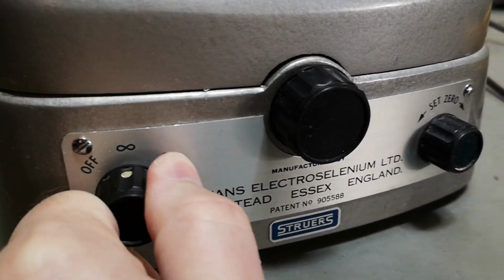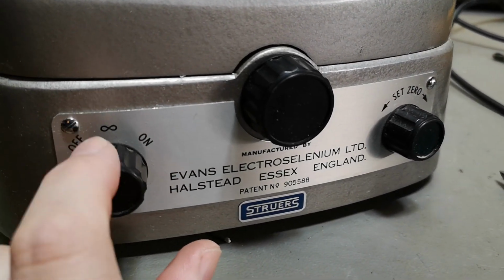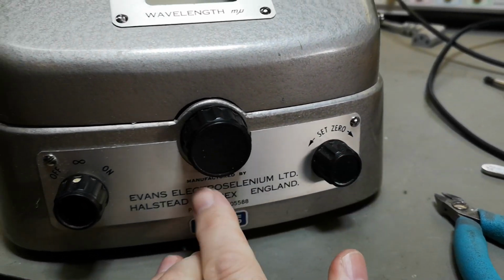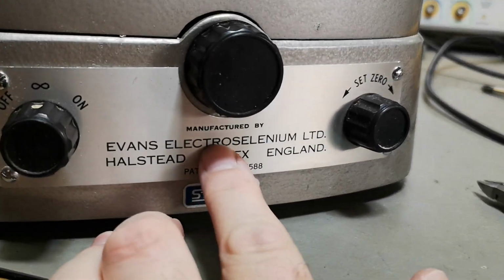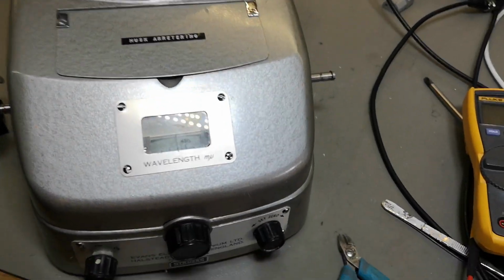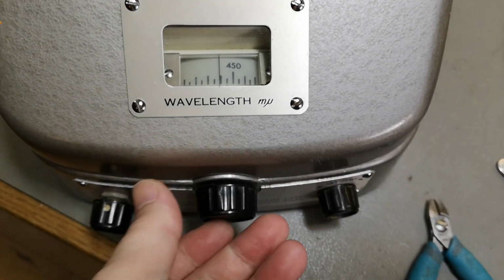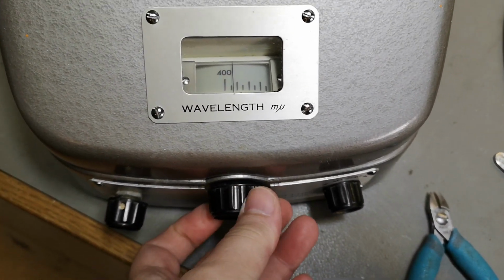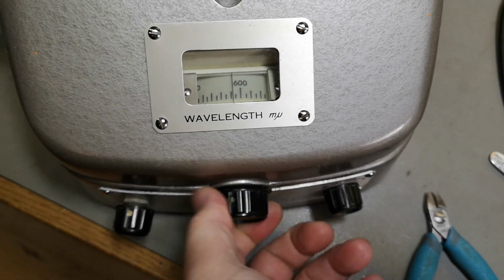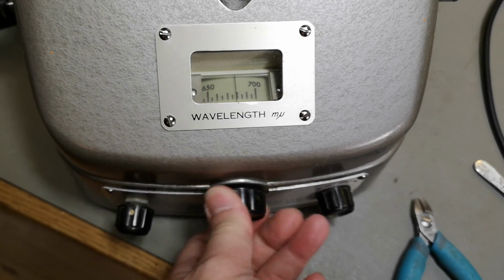What are we doing here? This has something to do with some calibration. Set 0. And then there's a mechanical wavelength. Look at that. So the readout goes from 400 to 700 nanometers.